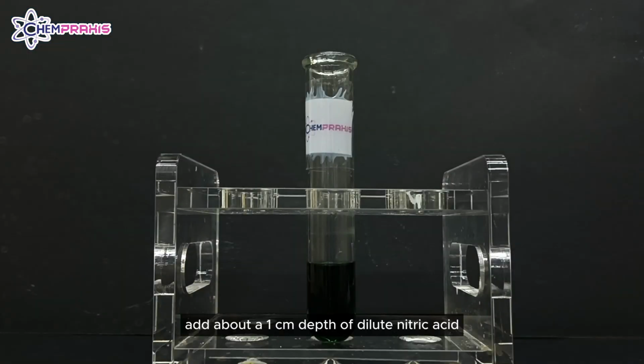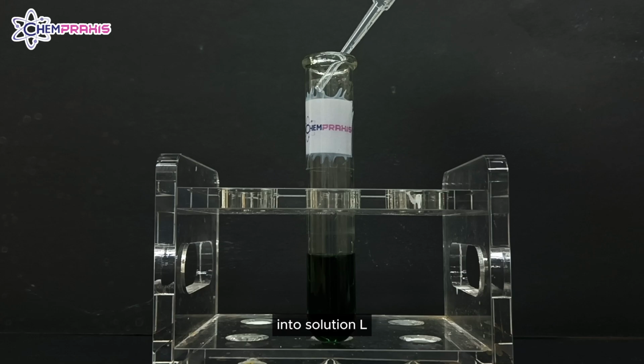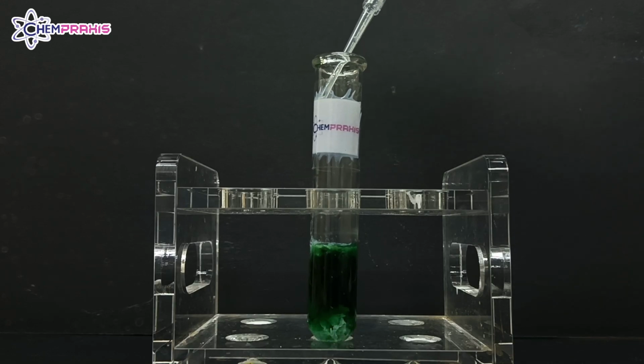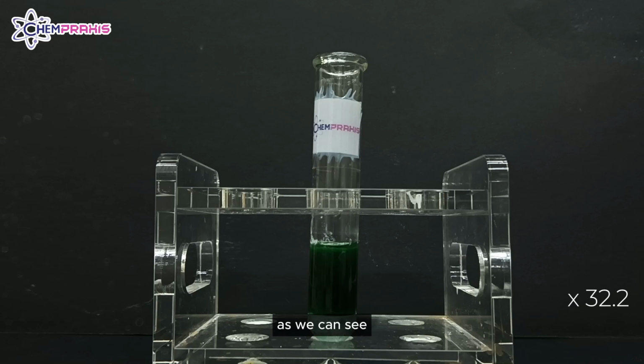Add about a 1 cm depth of dilute nitric acid followed by a 1 cm depth of aqueous silver nitrate into solution L. Leave the test tube for at least 5 minutes. As we can see, after it has been left there for 5 minutes, white precipitate is formed.